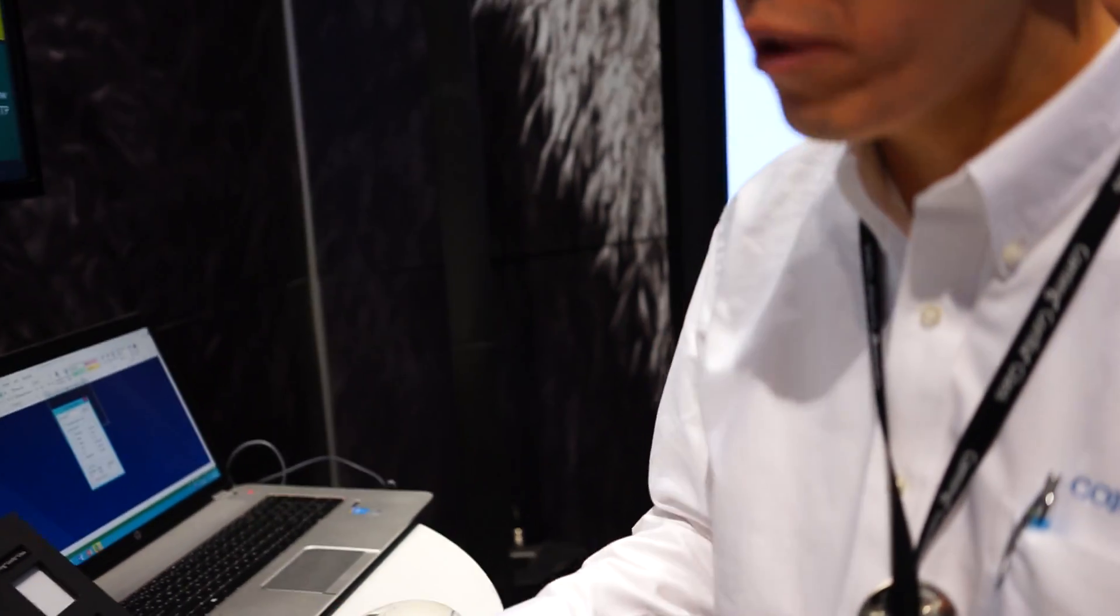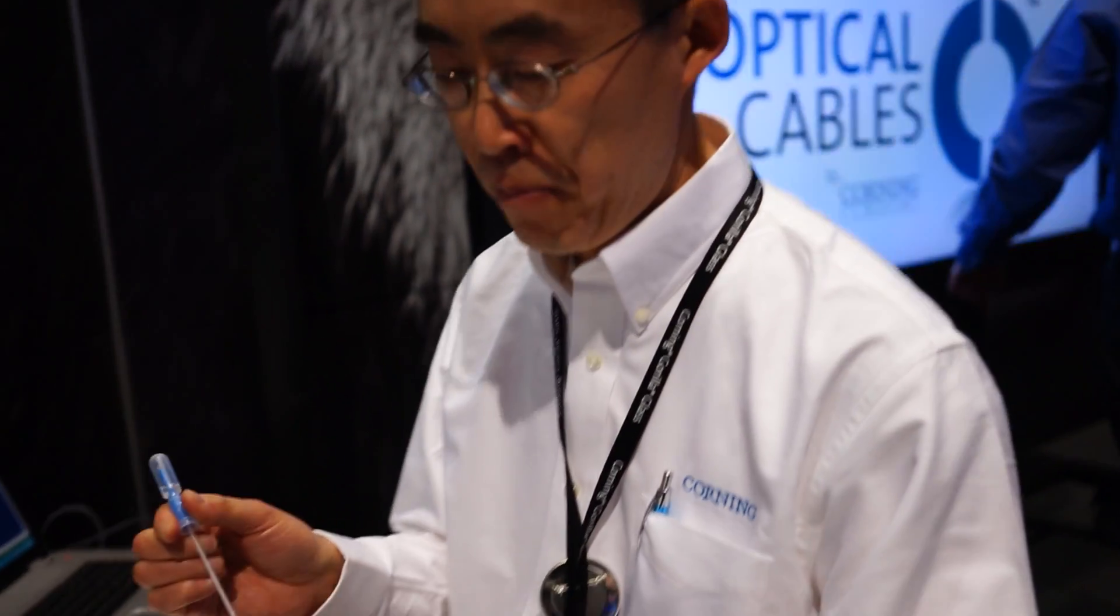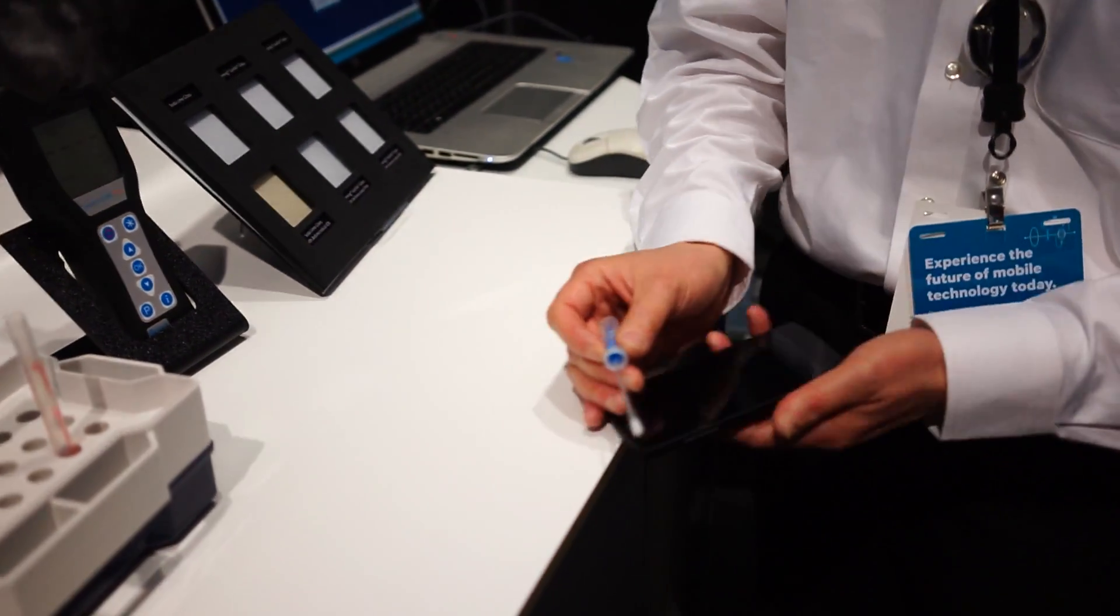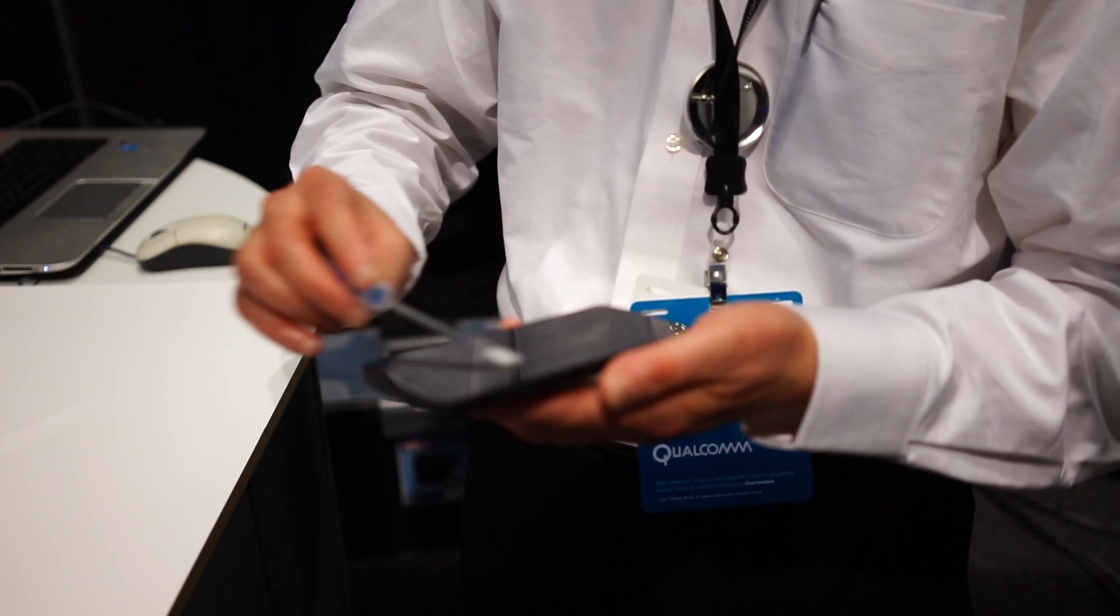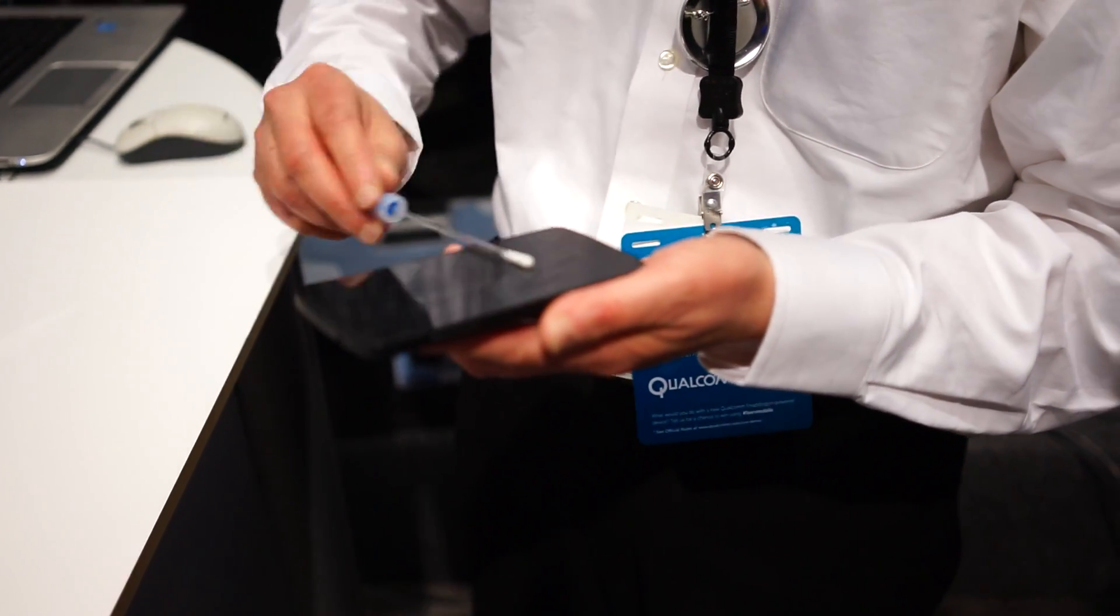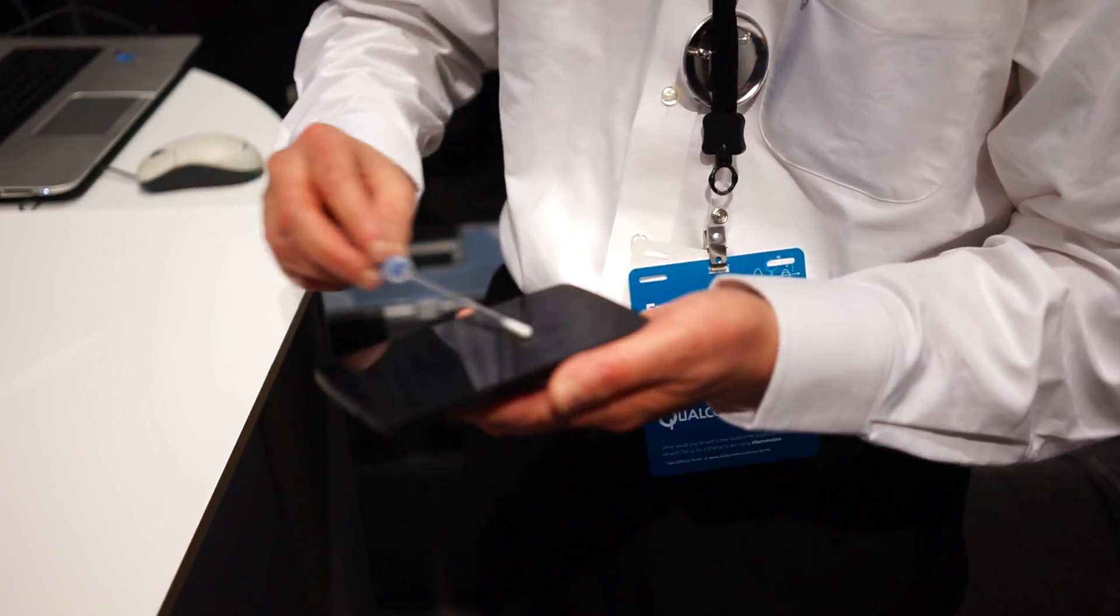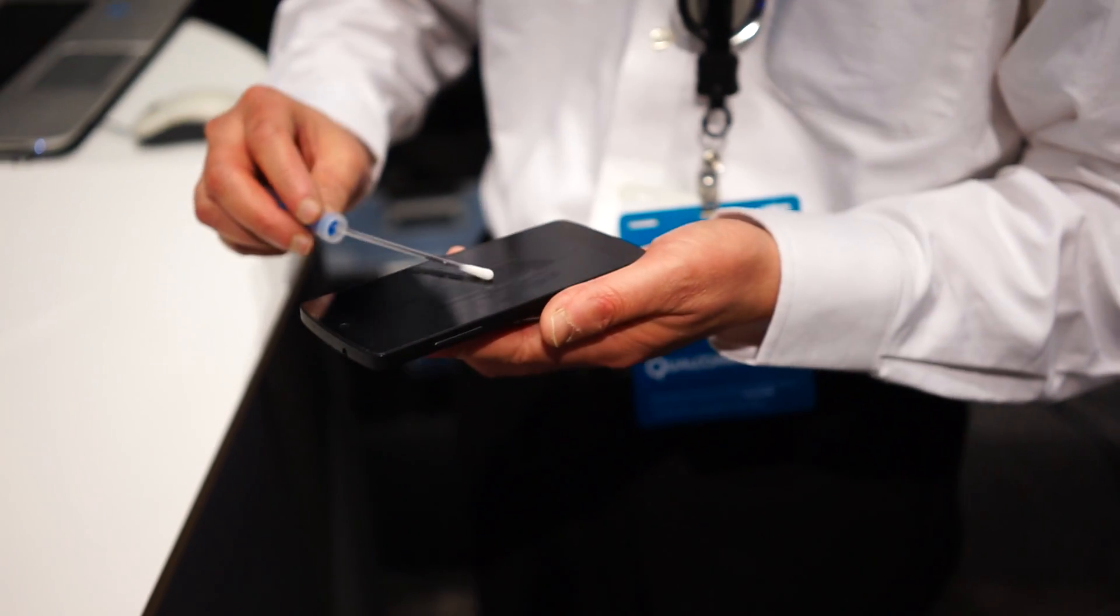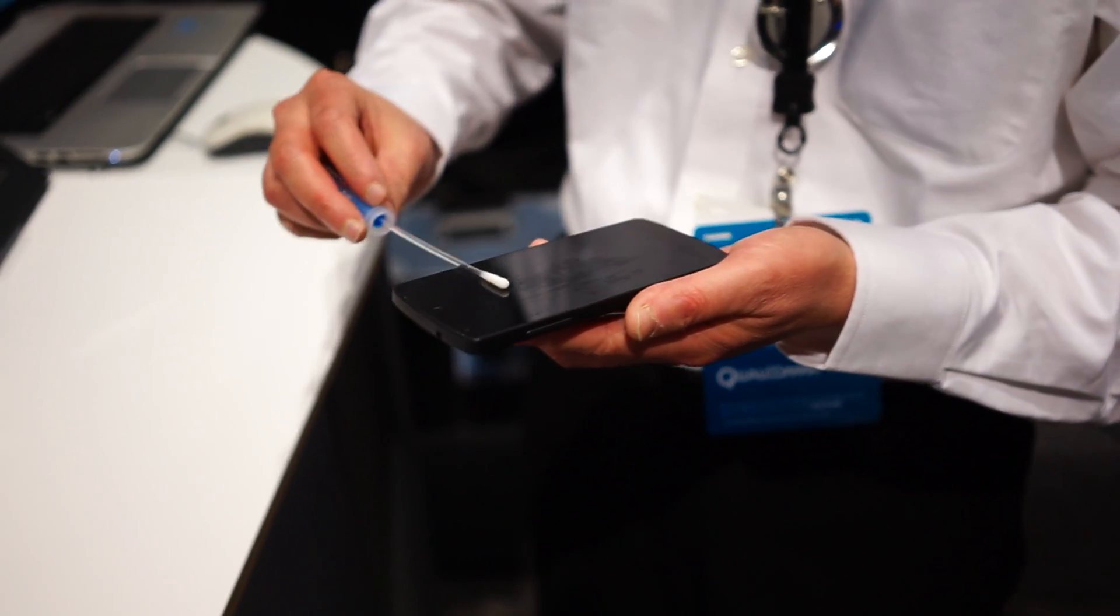What we have here is an ATP meter. It's a device widely used in the food industry that checks surface contamination levels. Basically what it does is you use a swab dampened with water and you swab it on the device surface. It picks up organic residue, whatever is on your phone surface. When we put it back in the meter, it's going to give you a reading that tells you the level of the organic residue.